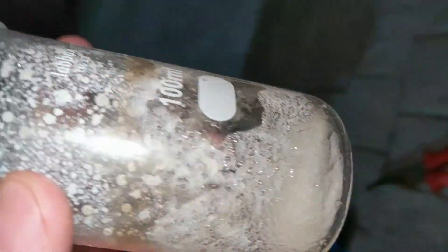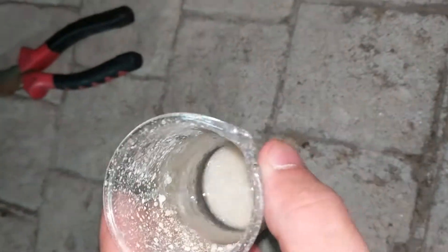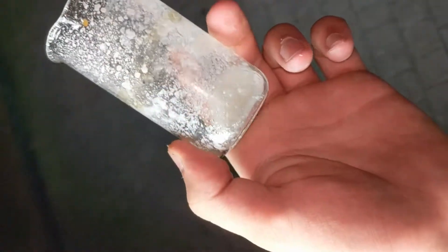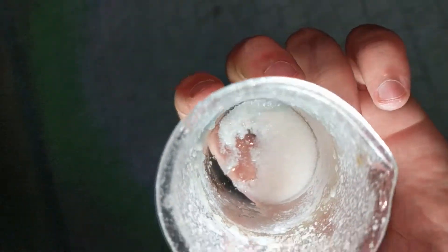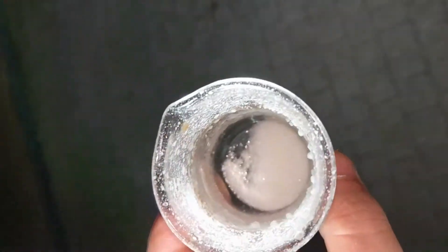That's probably enough — I didn't think I decomposed it very much, and I only added about four grams of silver to begin with, so I wasn't expecting much silver nitrate anyway. That's basically removed most of the brown gunk and given me some nice crystalline silver nitrate. So if you ever burn this up or accidentally heat it too much like I did — goof-ups happen — just add a bit more acid and there you go.